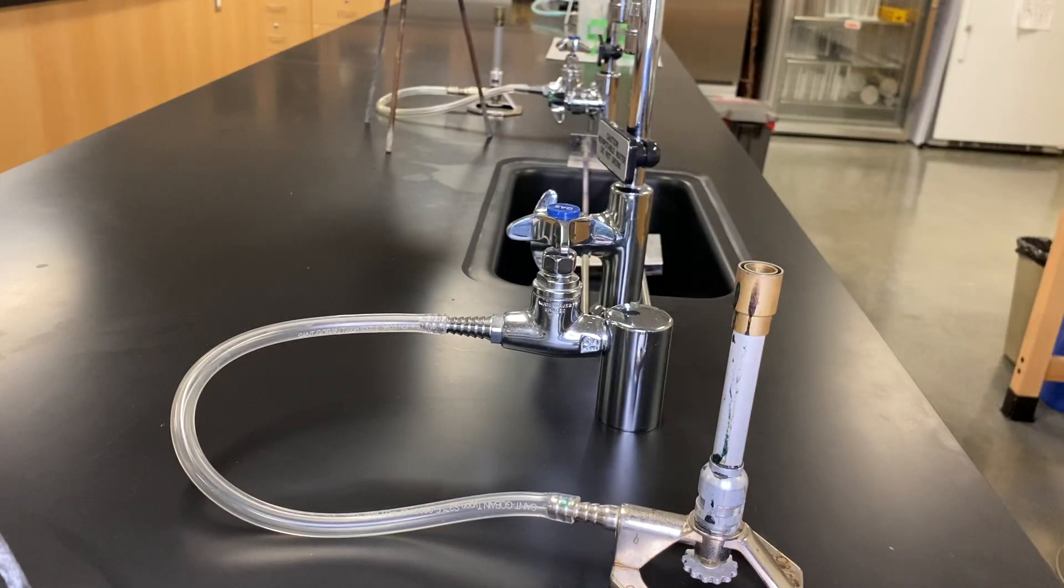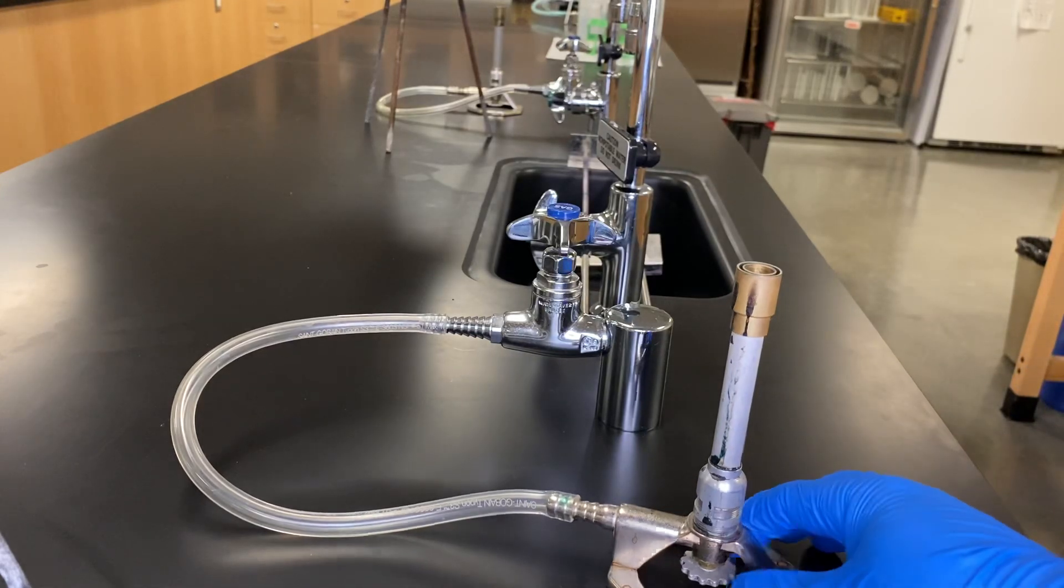So let's close it up. And that's pretty much our basics for how to use our Bunsen burner. So the important parts, obviously, keep in mind that this does get hot. So you shouldn't be messing with it very much.